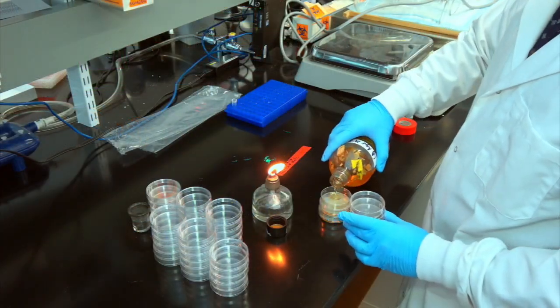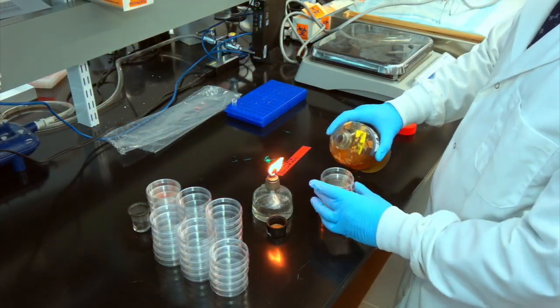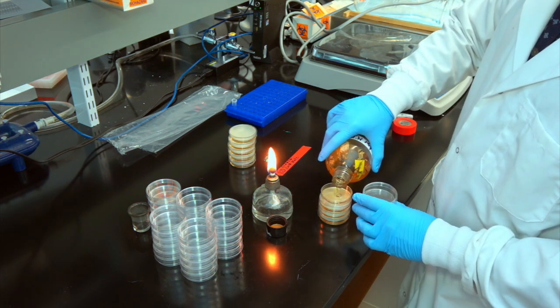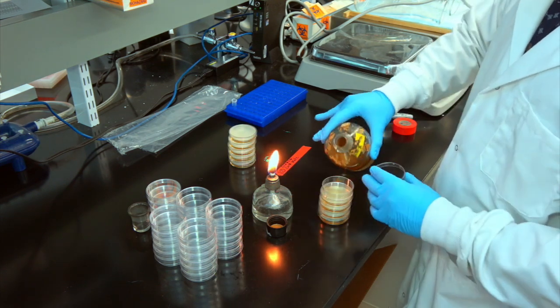If you're making plates without any antibiotic, you can alternatively re-liquify the LB agar by running it through the autoclave again or by microwaving. If you microwave, beware of over-boiling.